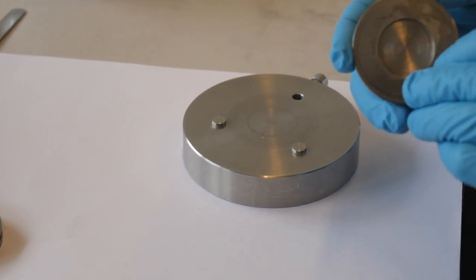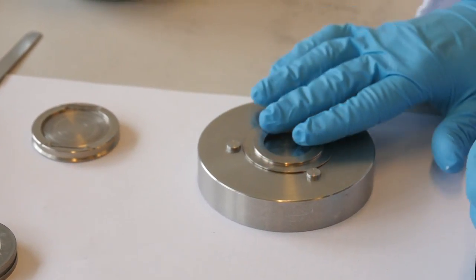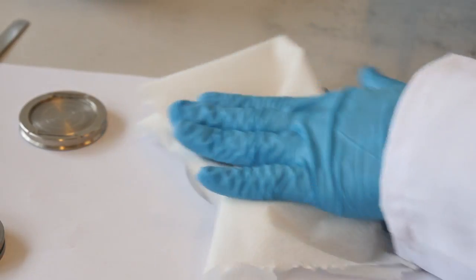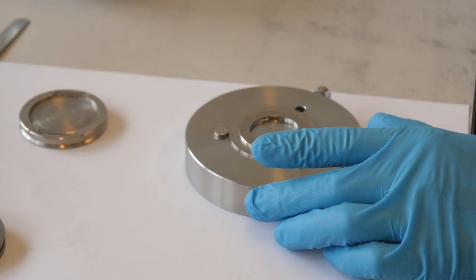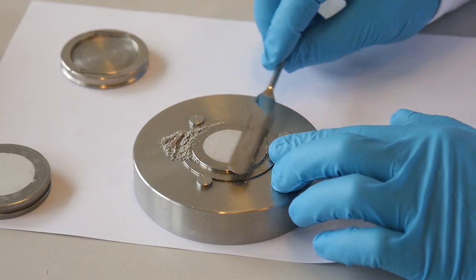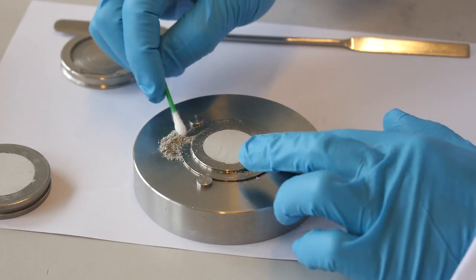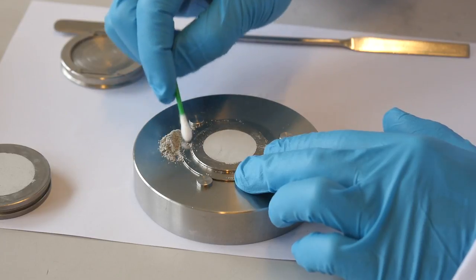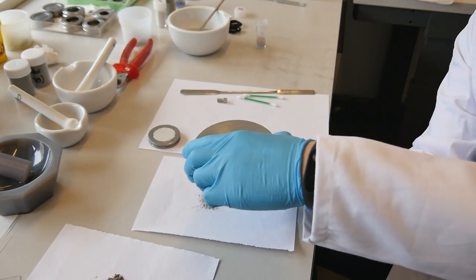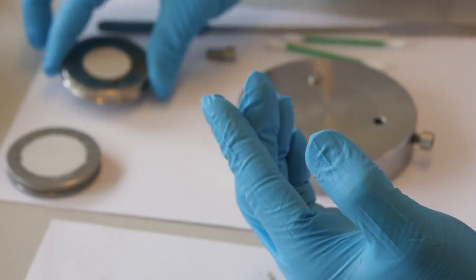Back loading is recommended for powder samples to avoid potential preferred orientations. Preferred orientation will be an issue for Rietveld analysis even if we can correct it mathematically, so it is better to avoid it during sample preparation. Clean the stage and fix the top part of the sample holder on the stage. Fill half of the cavity with powder, spread and press very gently to pack. Then fill the rest of the space with more powder and spread it with the edge of the spatula. Plane the surface and remove the excess powder. Unlock the top piece, put back the lower part of the sample holder, turn it over together with the stage, rotate the sample holder by about 10 degrees, then remove it from the stage and clean the edges.